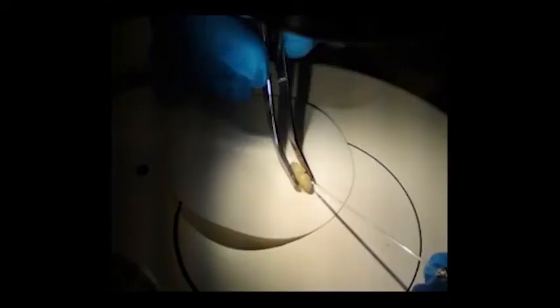There's a liquid component to it that just absorbs into the paper, and so we can see that waste here. It just absorbs in the paper and doesn't hurt them at all. And so these bees, we let mature until they get to the right stage. They will mature all the way to adulthood. But we can also use them to inject with viruses and then harvest these virus particles for the experiments that we do in the lab.